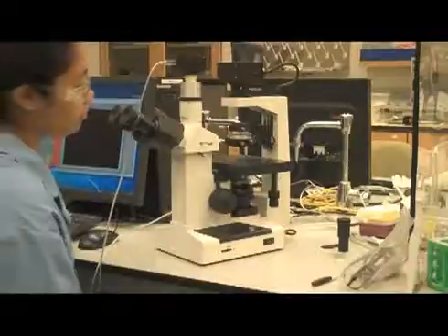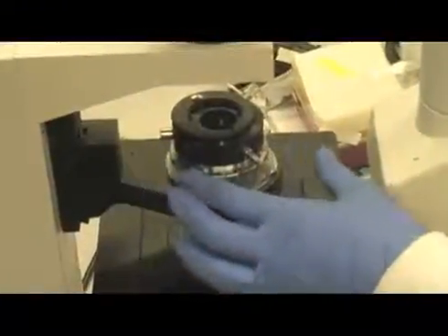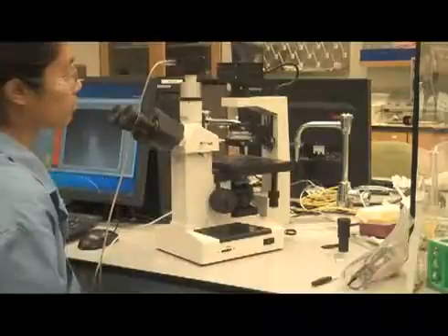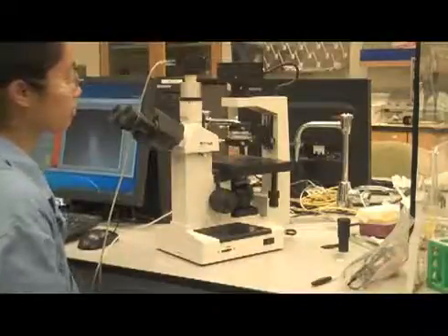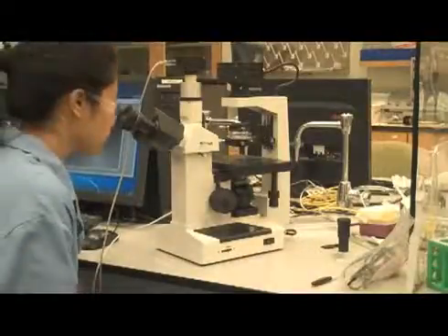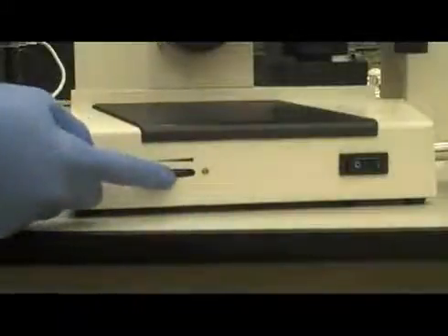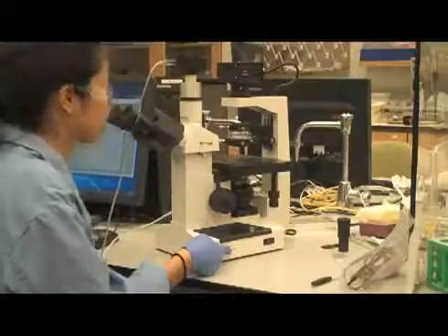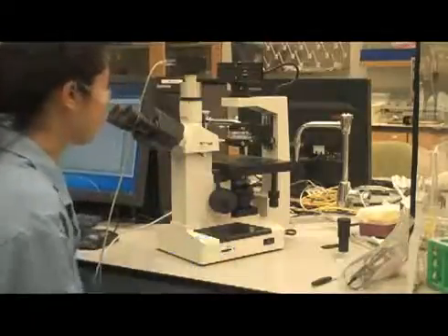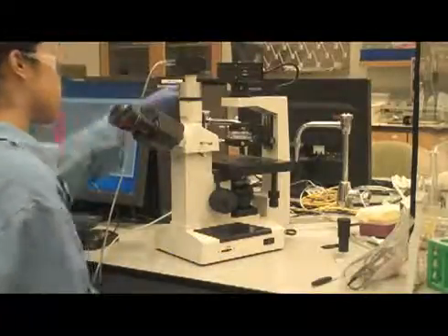Step 4: Turn the aperture dial counterclockwise until the dial stops to open the aperture and allow for light to pass through. Step 5: While looking into the eyepiece, adjust the light control located on the side of the microscope towards the base. Turn the black wheel to observe the light brightness at a comfortable setting.